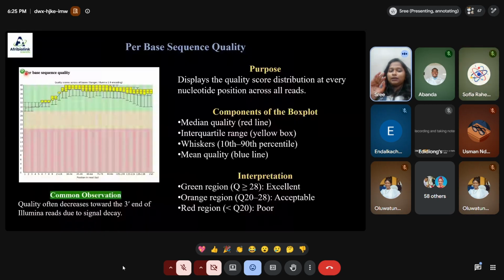It is often considered from the 3' ends of Illumina reads to understand whether the sequencing has taken place properly. You can see the graph is completely in the green regions, which tells us all these qualities are good. We can consider this for the analysis.